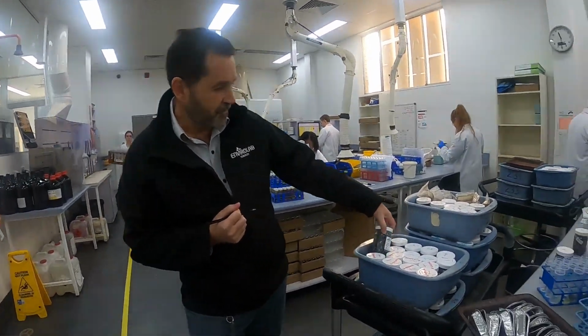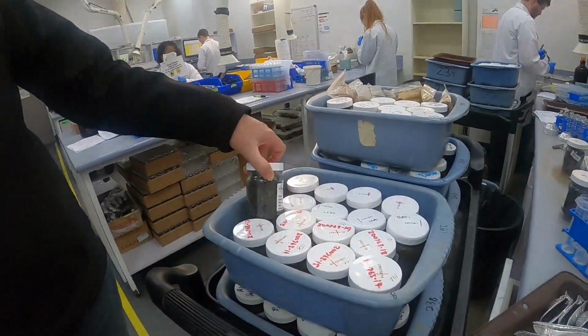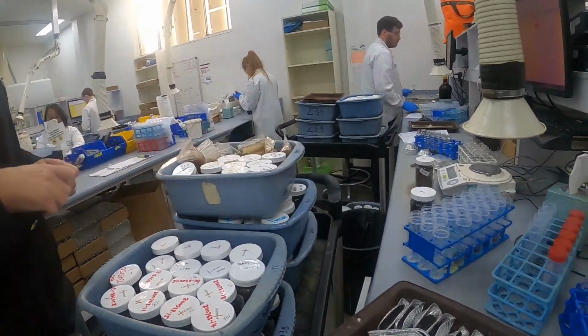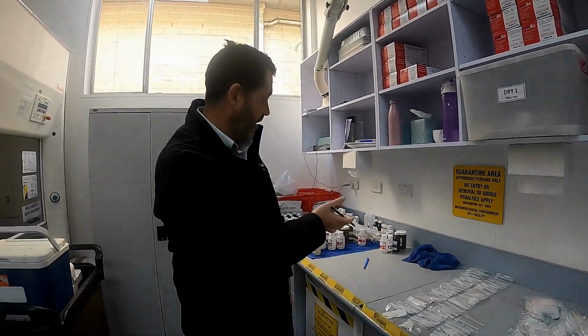All of our samples come in sample jars, generally 250 grams, but we also have some that are 125 grams. And this is the area where everything is weighed out. These are occupational hygiene samples. Now these particular ones are for lead in dust, but these could also look very similar to the samples we take for methamphetamines on surfaces.